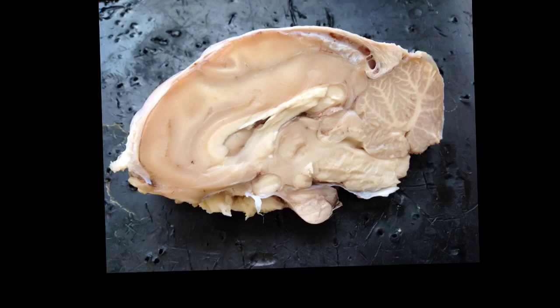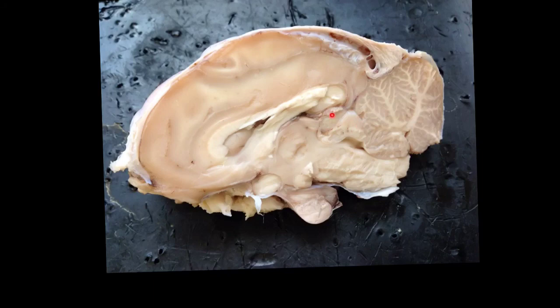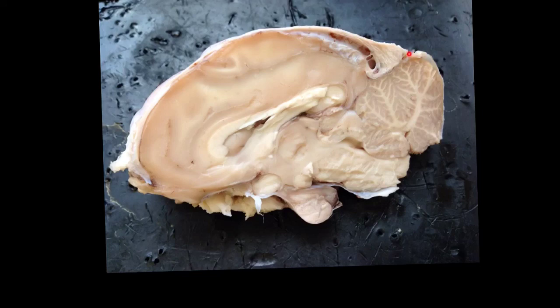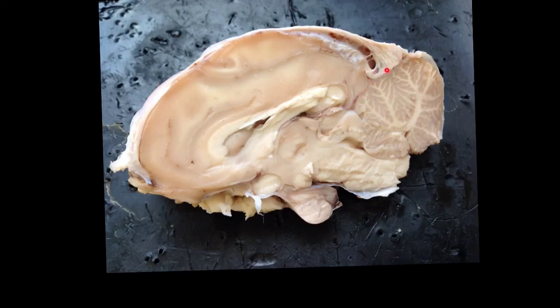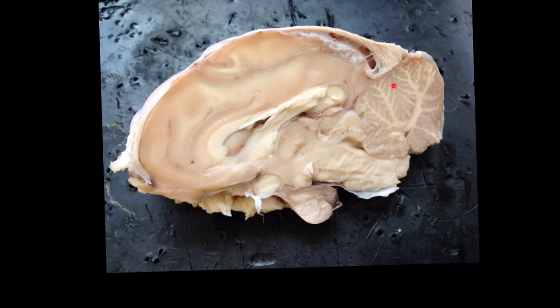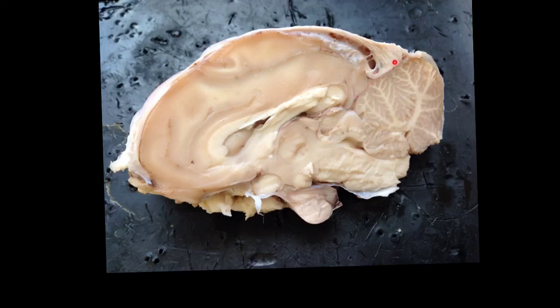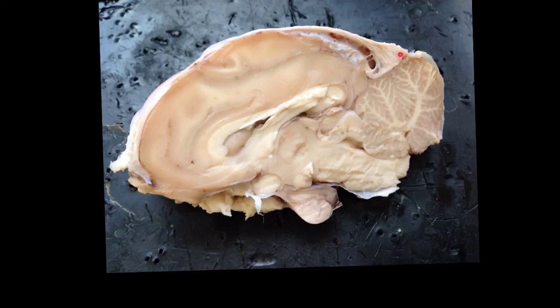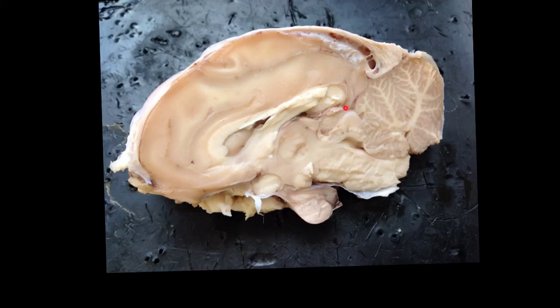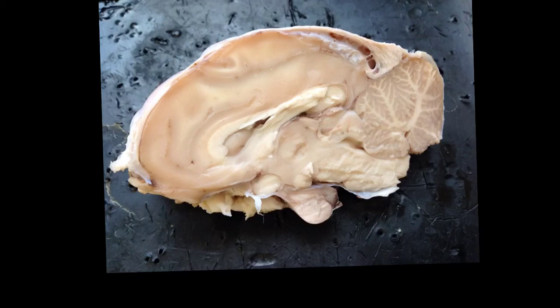The mid-sagittal section is actually not the best way to see the corpora quadrigemina. The best way, when you're actually doing the dissection, is to leave the brain intact, cut just above the cerebellum, pull this way and pull down — you'll create a fracture right here in the transverse fissure, which will expose the corpora quadrigemina.